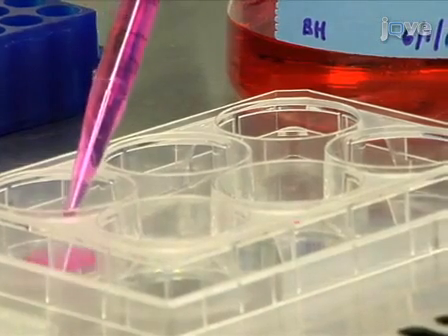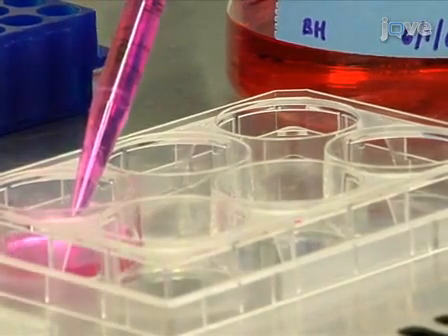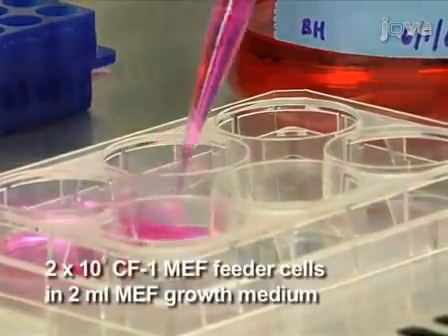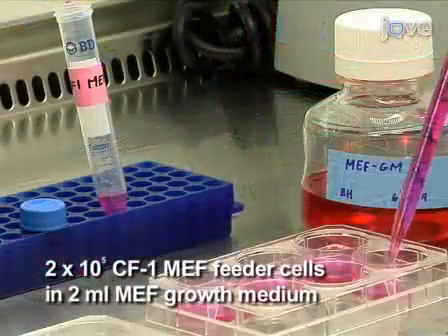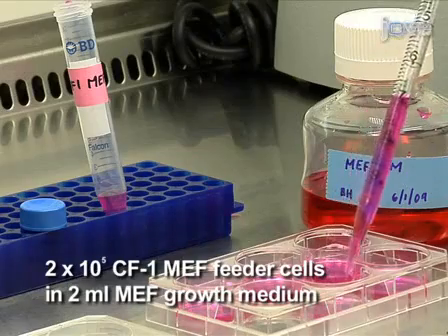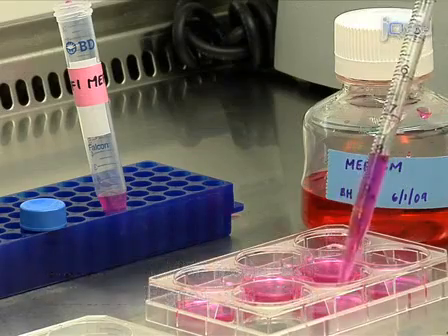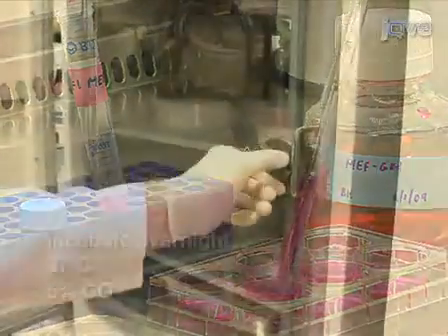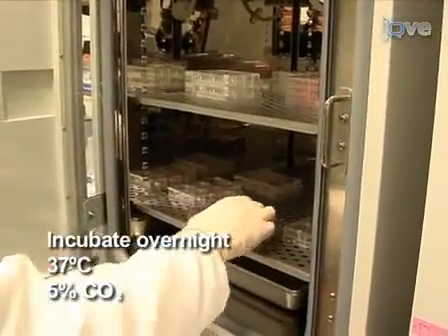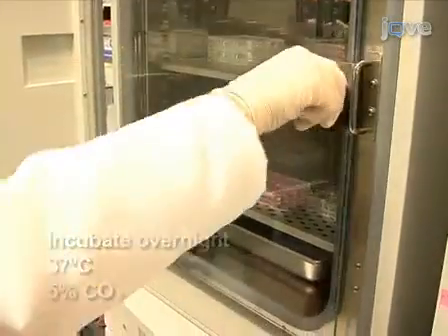To begin, seed each well of a six-well plate with two times ten to the fifth CF1 MEF feeder cells in two milliliters of MEF growth medium. Incubate overnight at 37 degrees Celsius and 5% carbon dioxide.